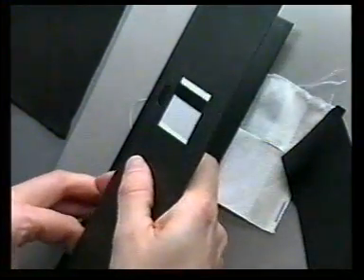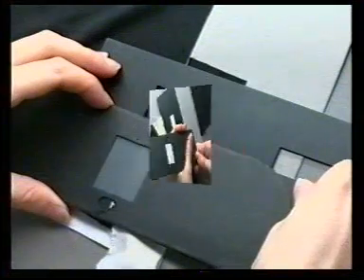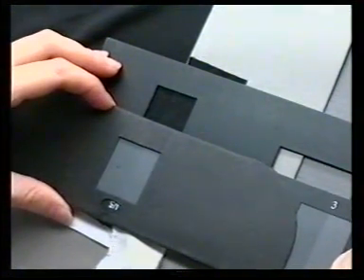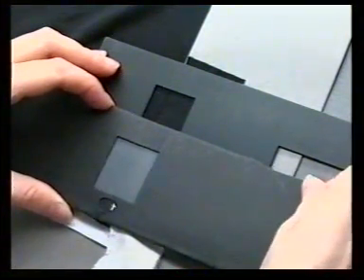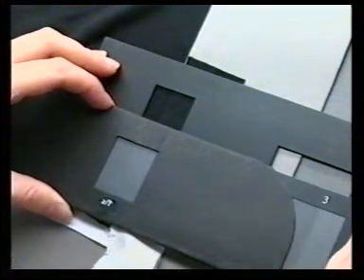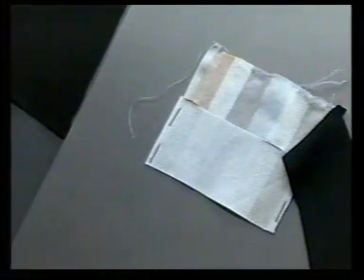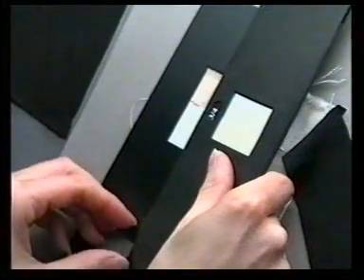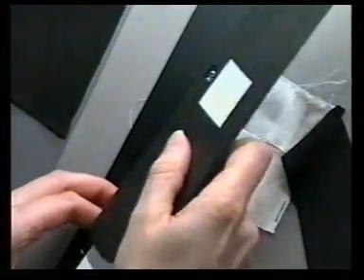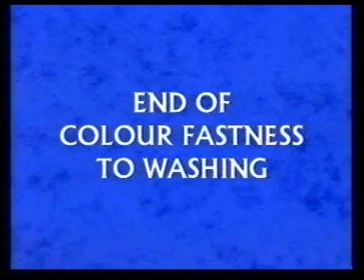When dry, the degree of staining and changing shade are assessed using the prescribed viewing cabinet under specified lighting conditions. The staining on the multifibre strip is compared to the colourfastness staining grayscales and a grade given from 1 to 5 for each of the 6 fibres in the strip. The change in shade of the test specimen is compared to an original unwashed specimen using the colourfastness shade change grayscales and a grade given from 1 to 5.